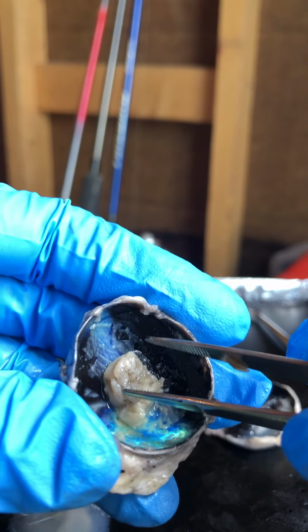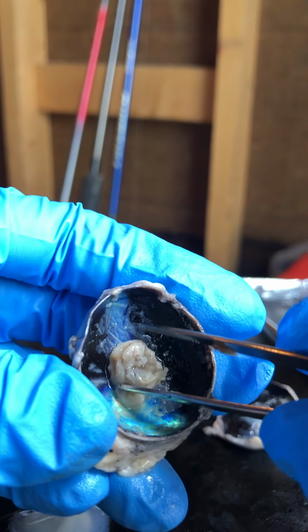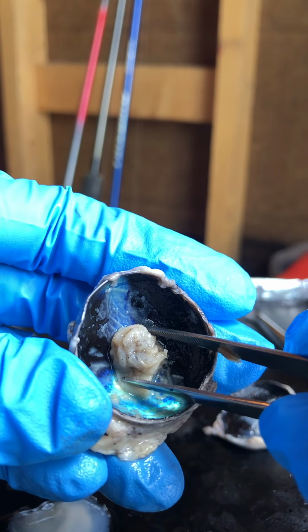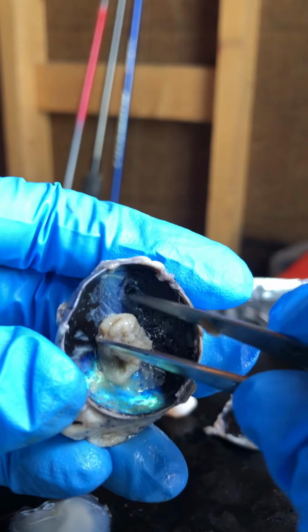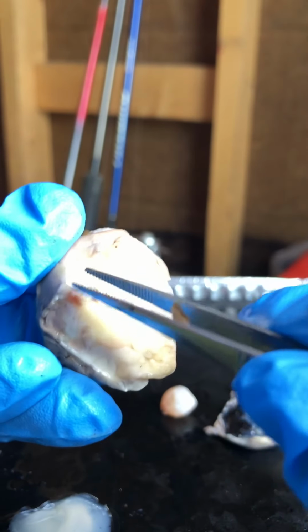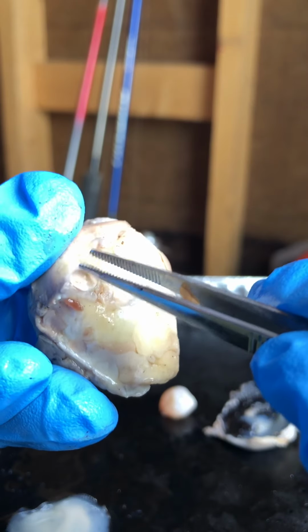It is the axons of the nerves of the retina. All of the axons of the nerves of the retina pass through the back of the eye, and where they pass through is referred to as the optic disc or blind spot, because light cannot be detected there. So all these axons pass through the back at the optic nerve here. That's where they exit and go to the brain.